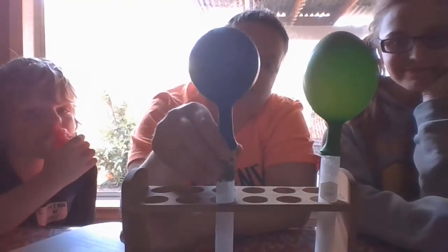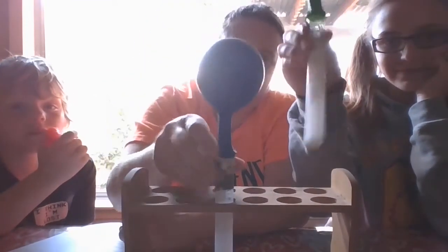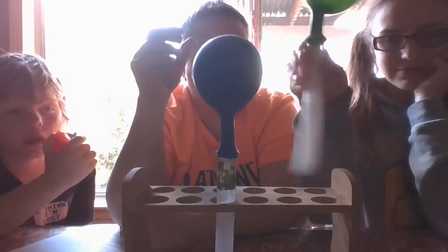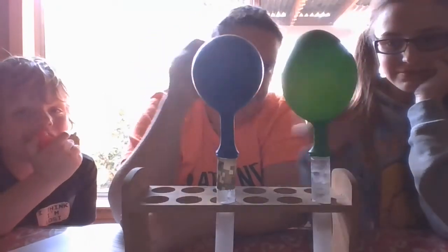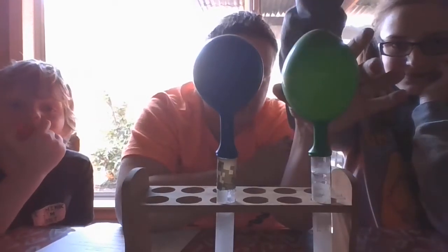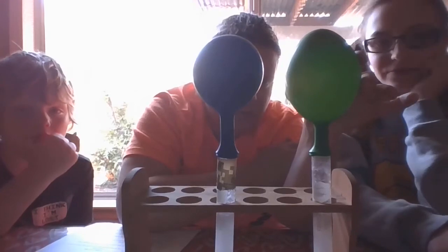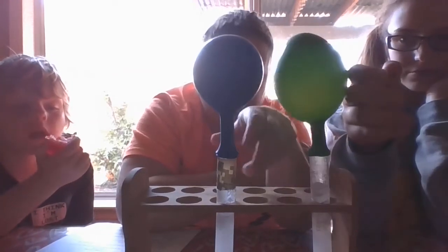Don't give them the answer now. And we're going to give them a little shake. We're going to make some of this stuff happen. Josie, just give it a little shake, a little stir there. Okay, put it down. So you can see, hopefully, that the green balloon is a little bit bigger. Okay, so this one had more products producing. It's producing a little bit. It's actually stopping right now.